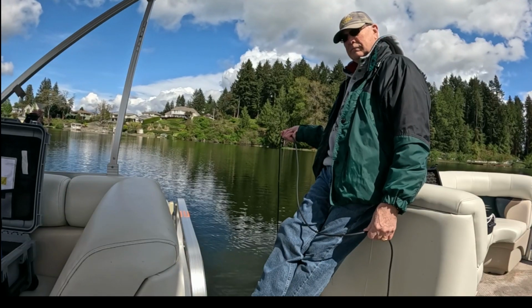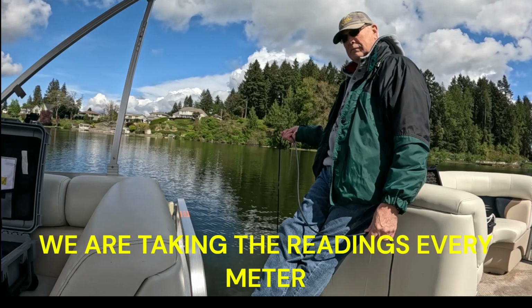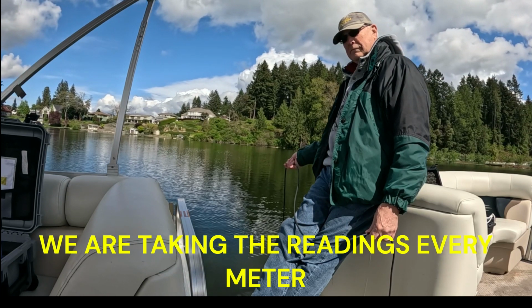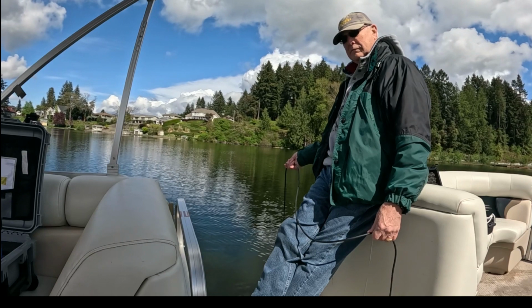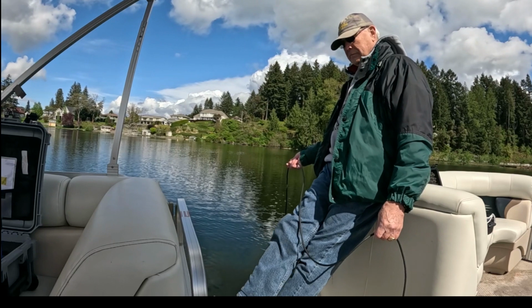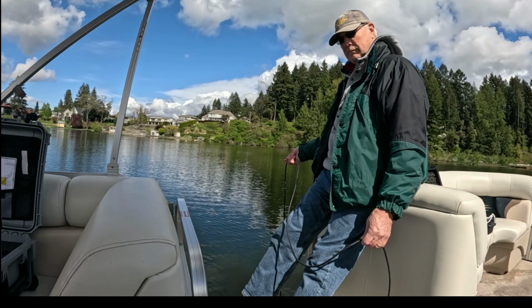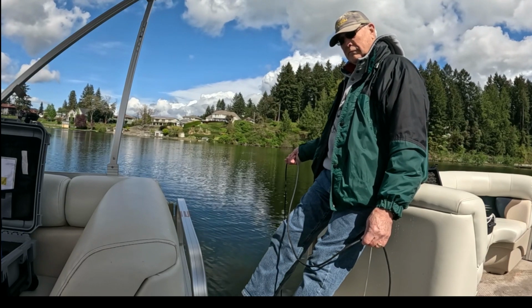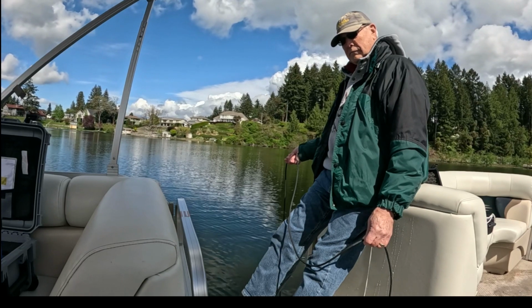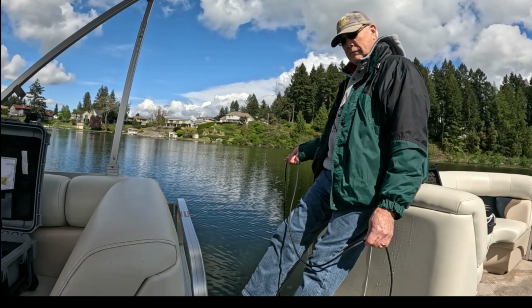2.5, right, a little bit lower, a little bit more, right there. 14. pH 7.61, pH is going down. DO is 10.06, about the same. SPC is 128.8. Turbidity is 1.08. Okay.